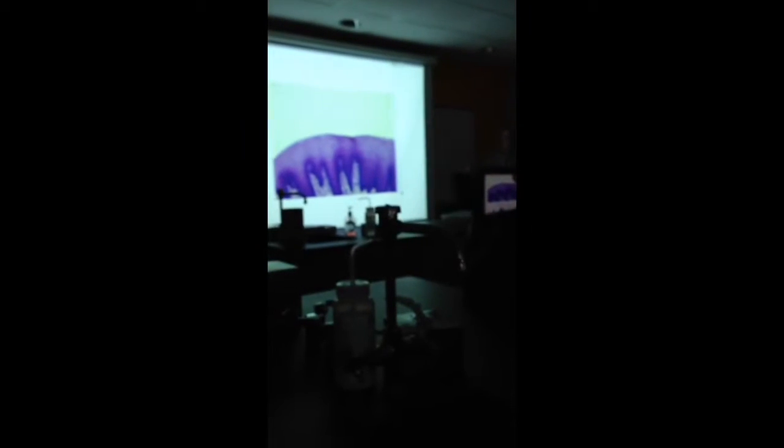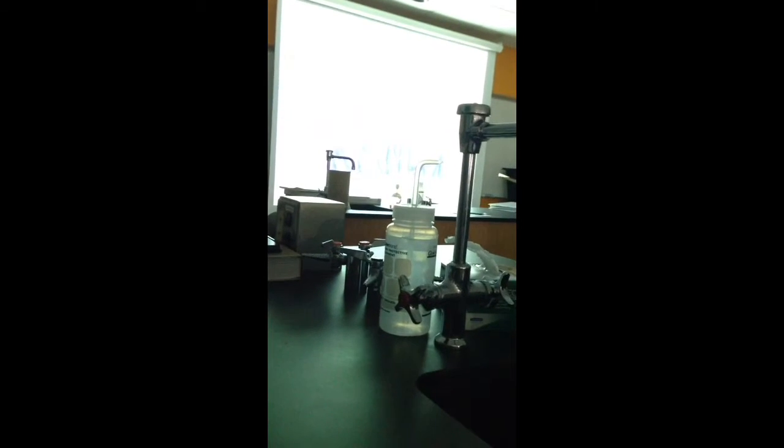Multiple layers of flattened cells. You can tell by the flattened nuclei here, even though you can't see the cell boundaries. So this covers most of the surface of the tongue. It lines the oral cavity, oral pharynx, laryngopharynx, and esophagus. Also, we find it in the anal canal, which is the distal end of the large intestine. Again, you've got a good thick protective layer here. You've got food and drink rubbing against the walls.